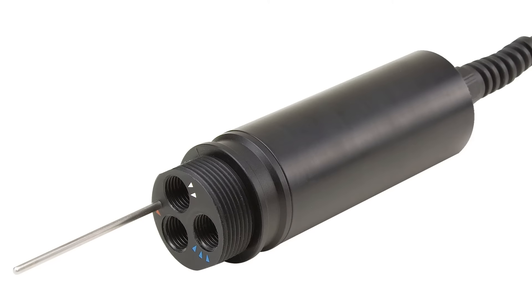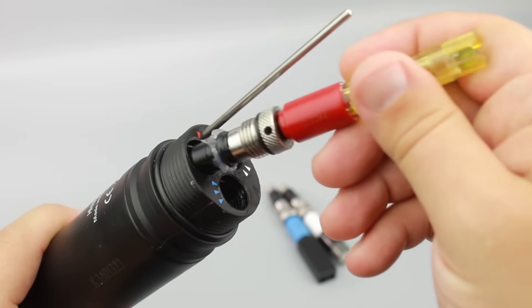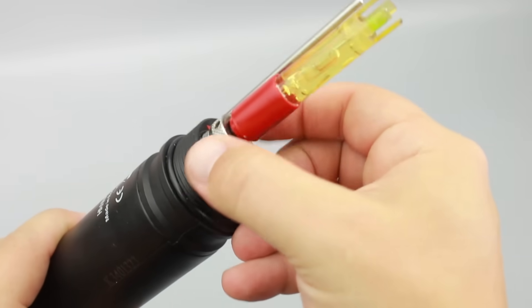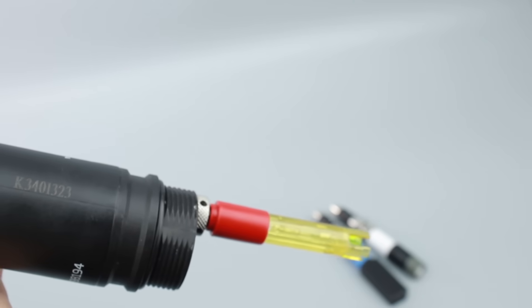These probes have two or three sensor connector sockets identified with color-coded triangles. Connector 1 can be a pH or pH/ORP sensor. Connector 2 is for the dissolved oxygen sensor. Connector 3 is for the EC sensor. Position the connector key on the sensor towards the center of the probe. Make sure the sensor is connected correctly before tightening the locking threads. Repeat for the remaining two sensors.